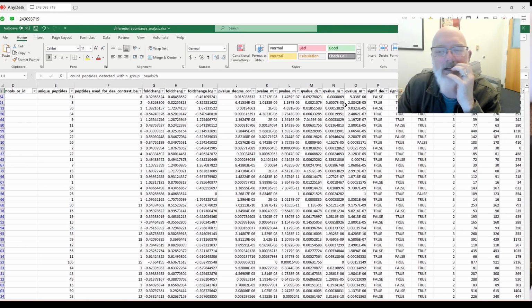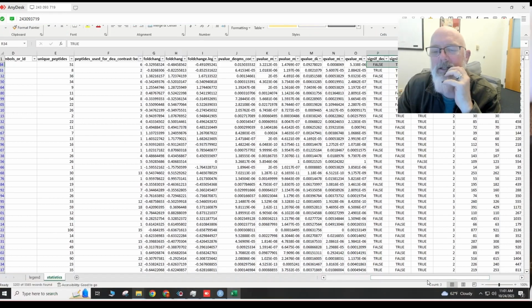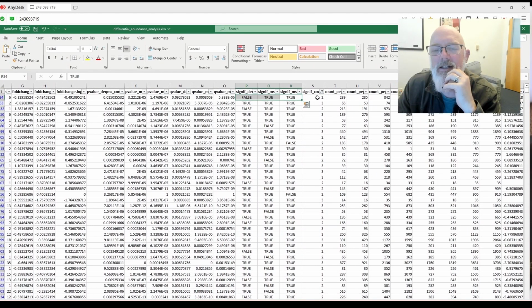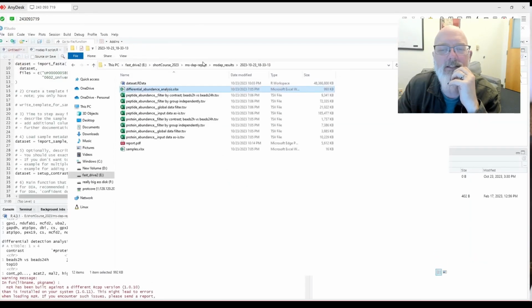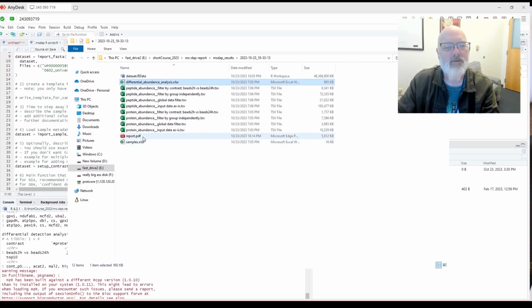That's interesting. Okay, that's actually really kind of cool. I wonder what the best approach should be. We'll have to go back and read the paper to see what they recommend. But that's really neat. I like that. Okay, very cool. I'm impressed so far. Let's not save that. And then it gives you this nice report. Let's go through the report.